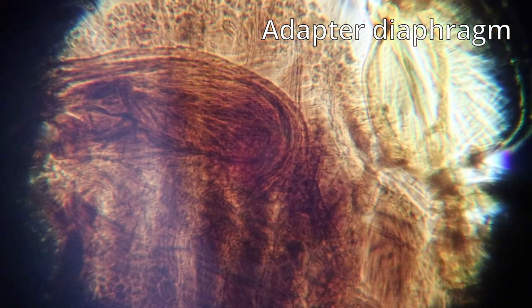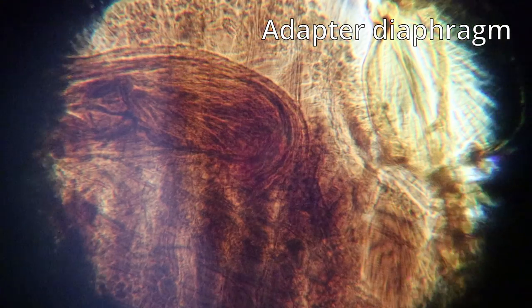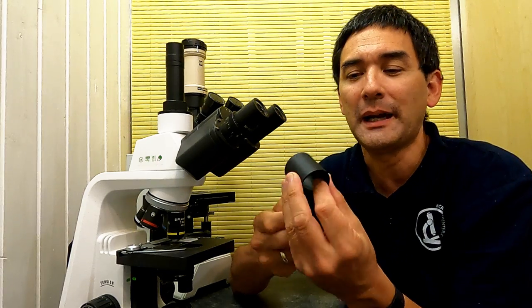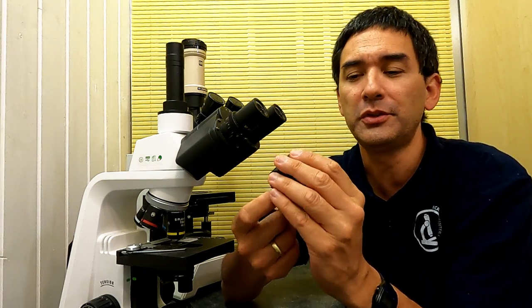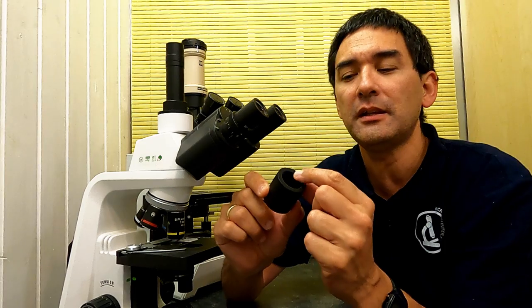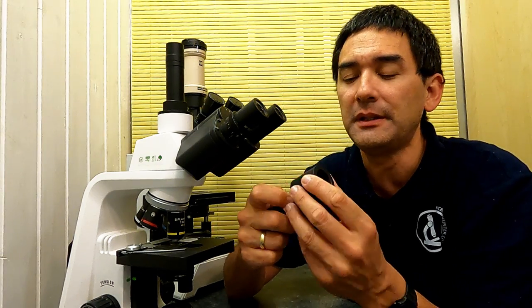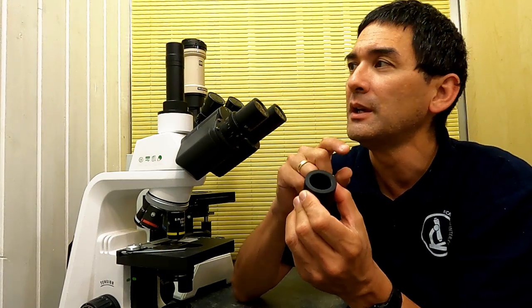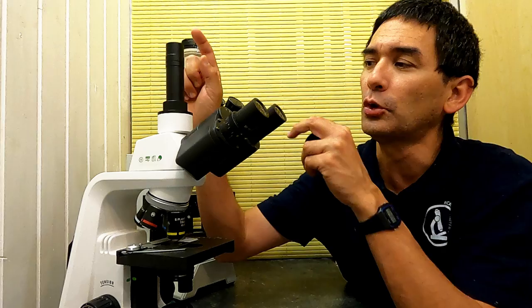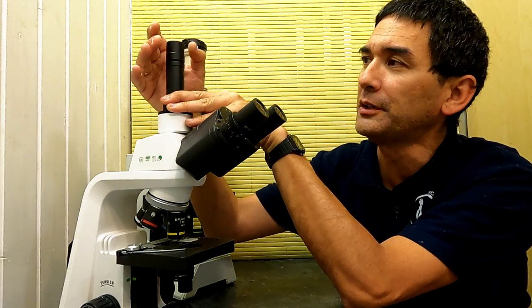So let's again look at the adapter diaphragm. That's what the adapter does. Okay, so I don't know, there's absolutely no point. Well, now let's have a slightly closer look at this adapter over here. You can look through it. So it's a regular aluminum tube, but there is a threading over here. I wondered where it could be connected to, and indeed I did find a place. This here is a so-called C-mount thread. So this means I can actually connect it to the top part of the photo tube, so I have to remove this top part here.